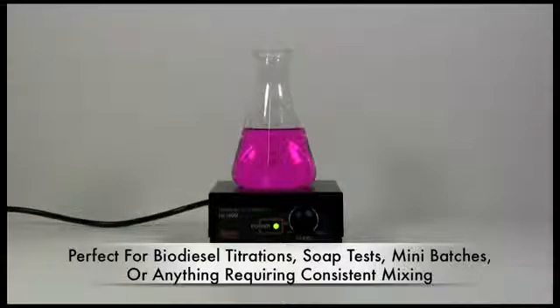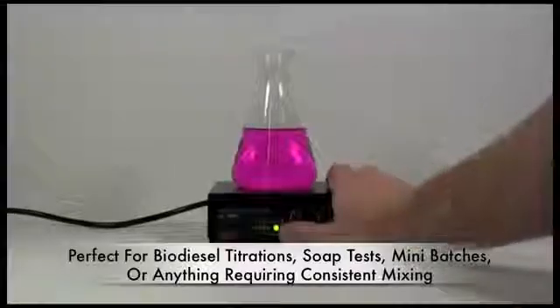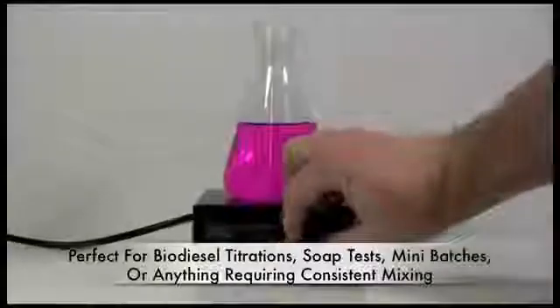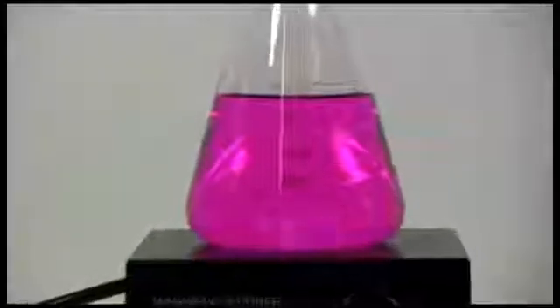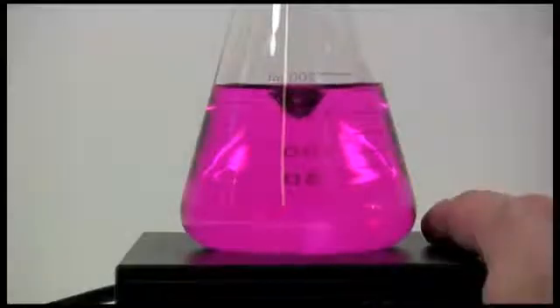You basically put a jar of liquid on top of it, put the stir bar in, and reach over and turn it on. Away it'll go. It starts out relatively slow, and then as you need to speed it up, you can.